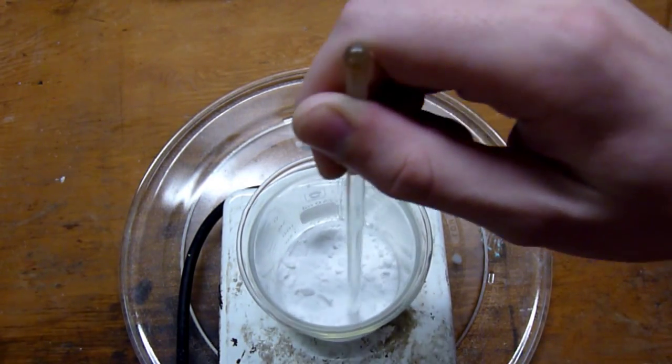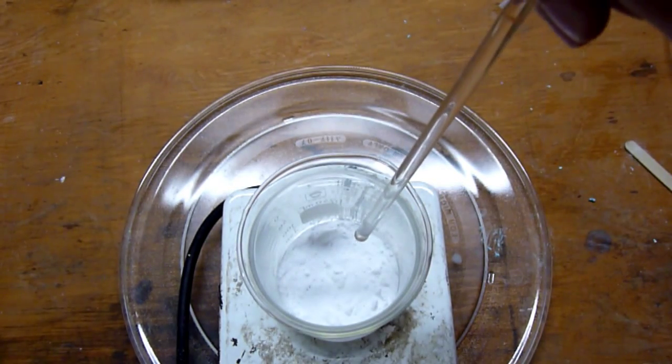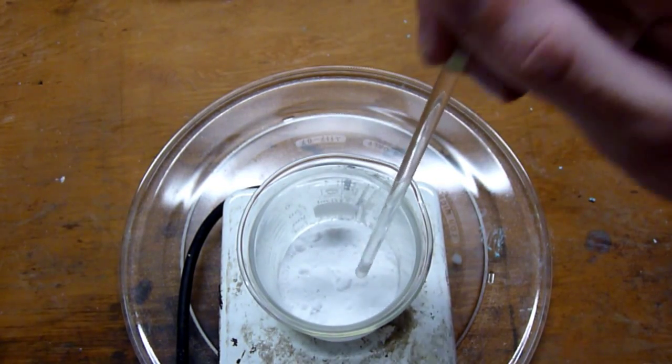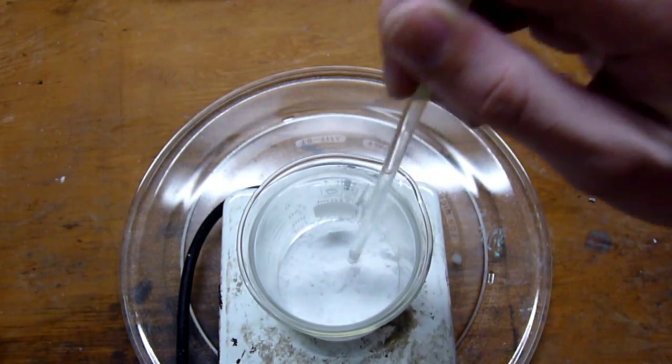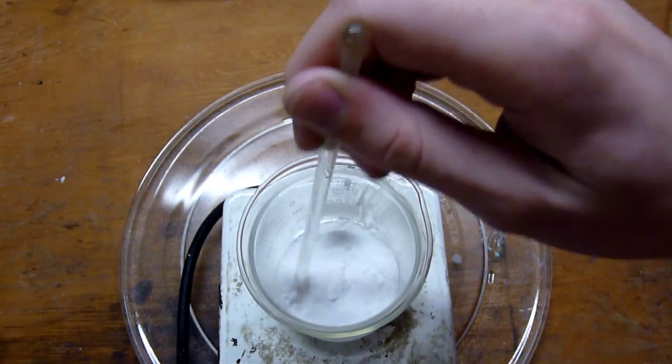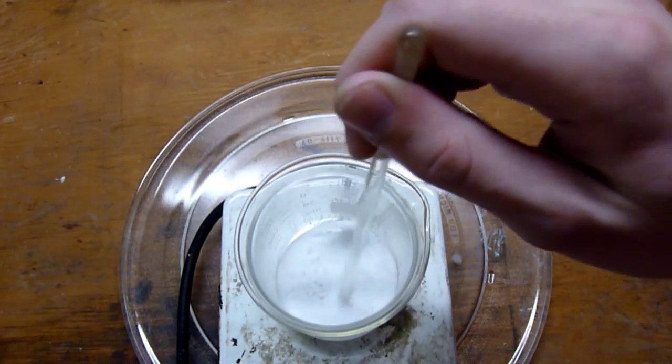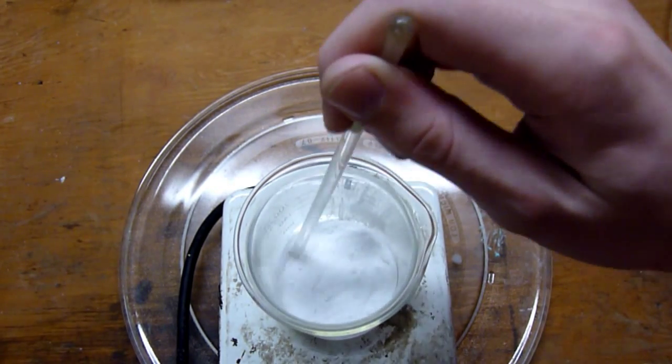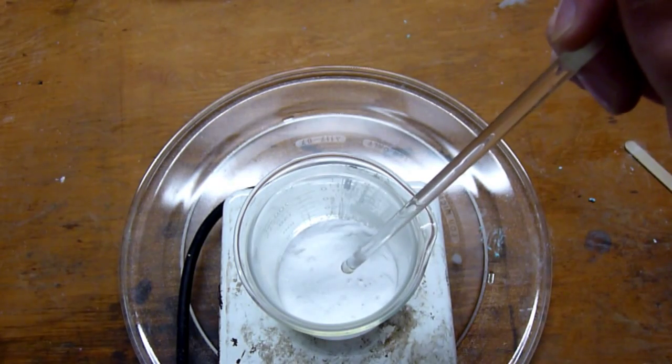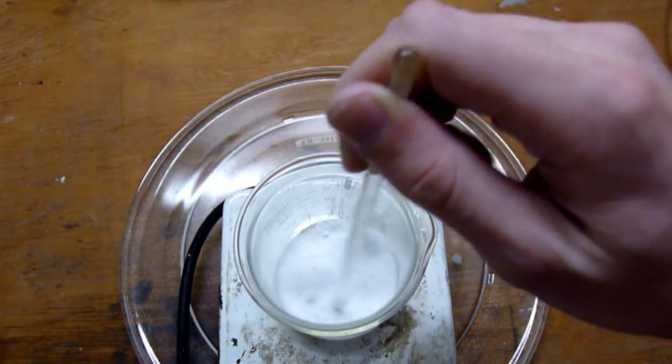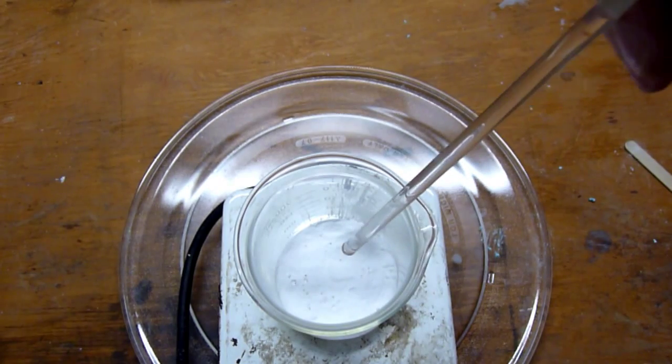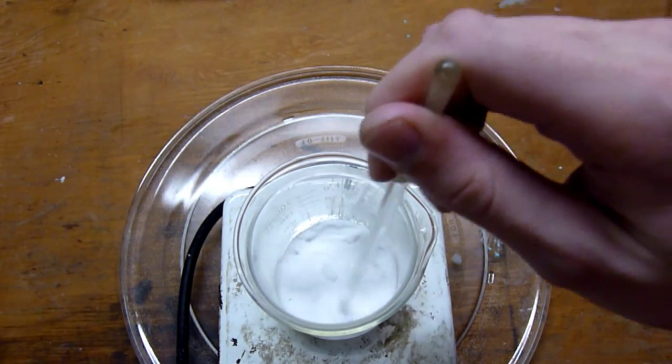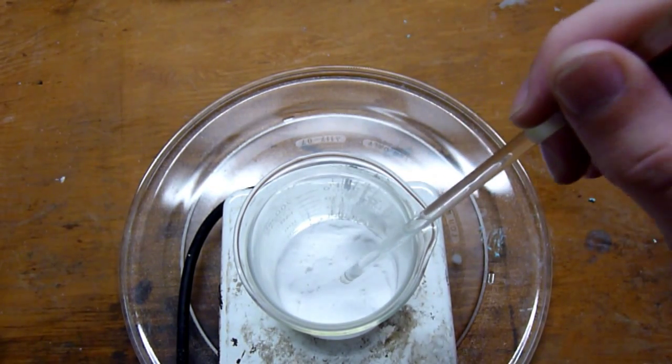As you can see, the gas coming right out of the powder. See? There, now it's really obvious. And that's simply water vapor and carbon dioxide being given off as the sodium hydrogen carbonate decomposes into sodium carbonate. And once this all has been converted to sodium carbonate, it will then dissolve it in water and mix it with our copper sulfate solution to form our copper 2 carbonate without the carbon dioxide this time.